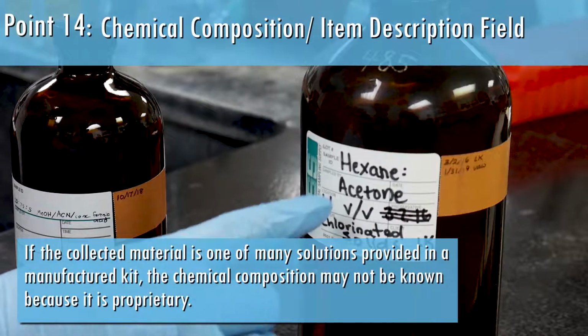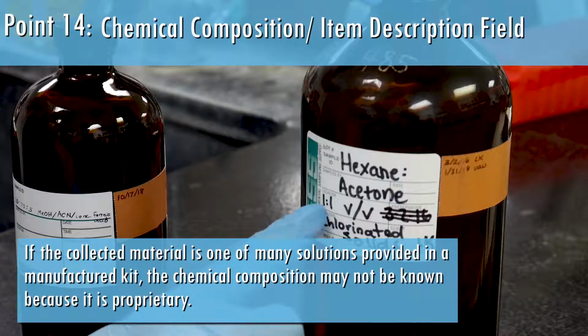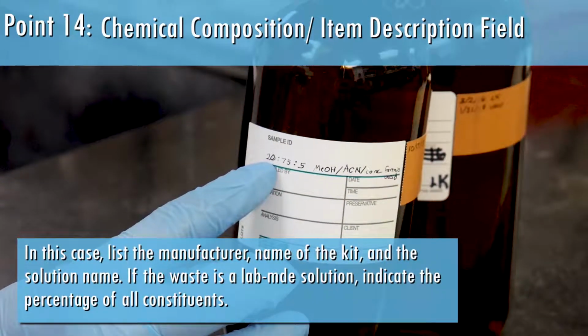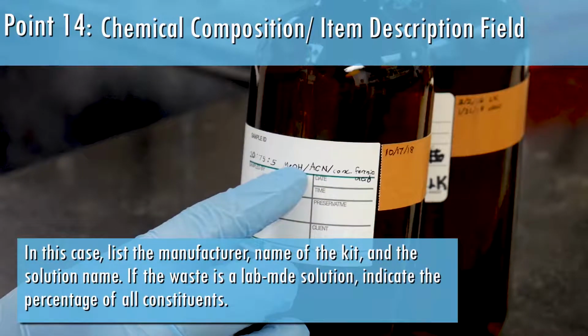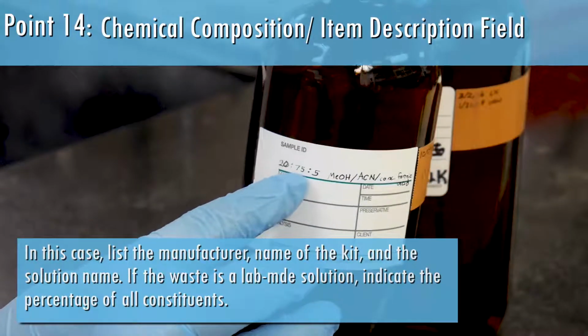If the collected material is one of many solutions provided in a manufactured kit, the chemical composition may not be known because it's proprietary. In this case, list the manufacturer, name of the kit, and the solution's name. If the waste is a lab-made solution, indicate the percentage of all constituents.